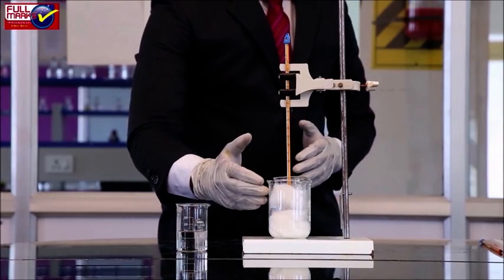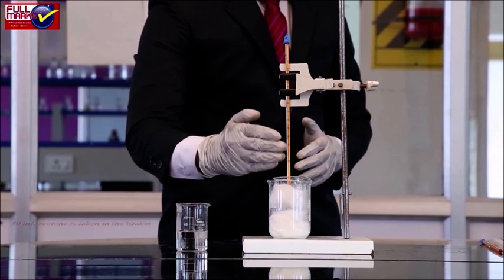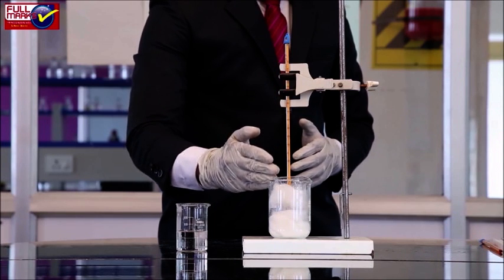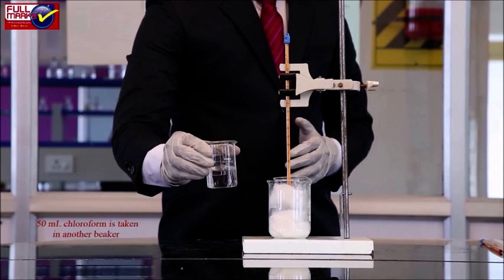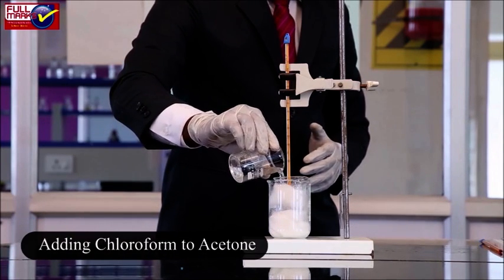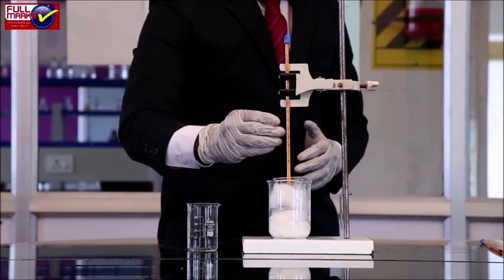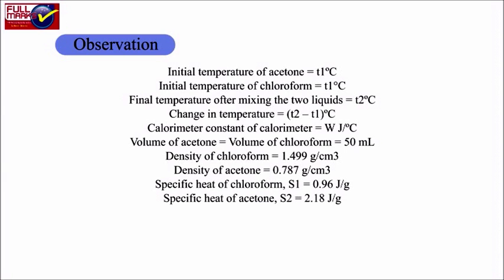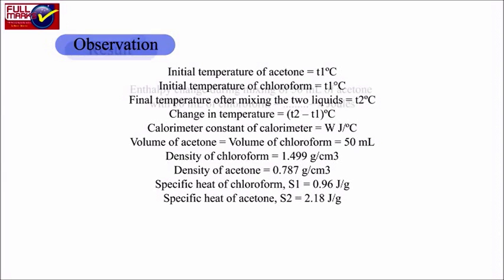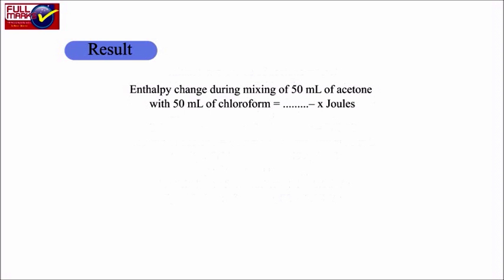Procedure: The calorimeter constant is determined as in the previous experiment. 50 ml of acetone is taken in a beaker whose water equivalent was determined, and it is kept in a thermally insulated beaker. Its temperature is recorded after some time. 50 ml of chloroform is taken in another beaker and its temperature is noted. Both temperatures should be the same. Chloroform is added to the previous beaker. The mixture is stirred and its temperature is noted. Observations. Result: Enthalpy change during mixing of 50 ml acetone with 50 ml chloroform.